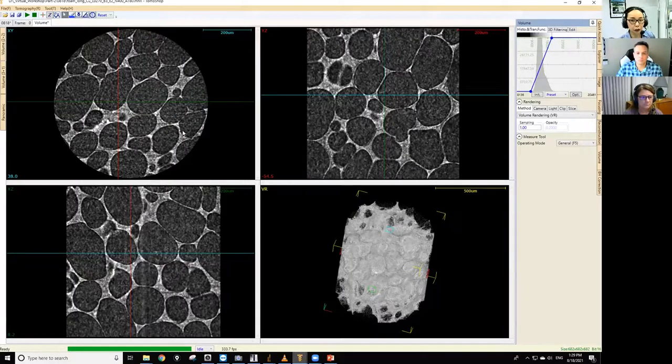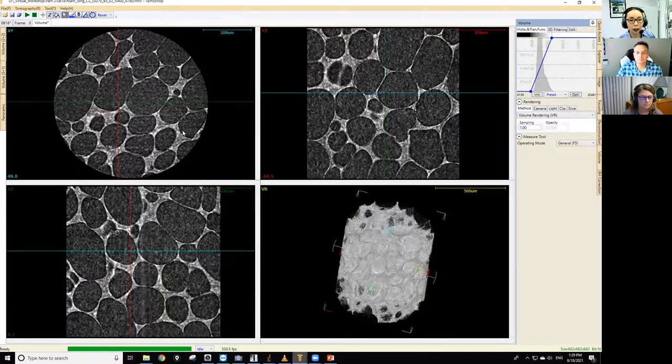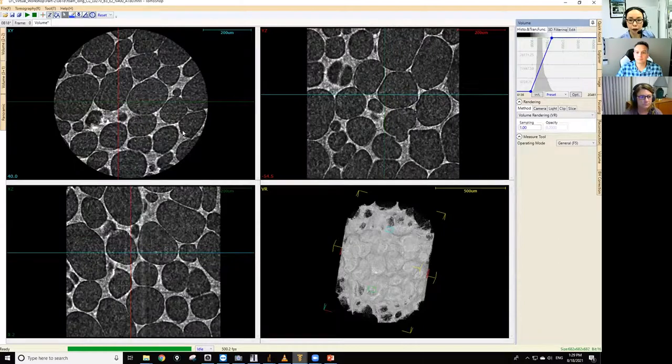They really shouldn't be there, but they are. And this is happening because that sample is a soft sample, right? And we made it really long. So it was probably moving a tiny bit during the scan. So that's one of the things you have to be careful about: the sample movement.